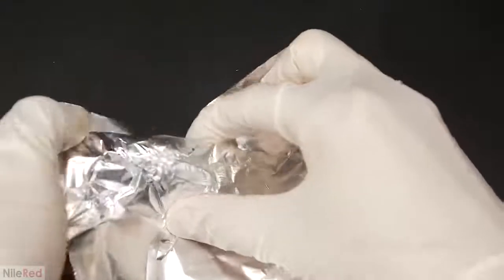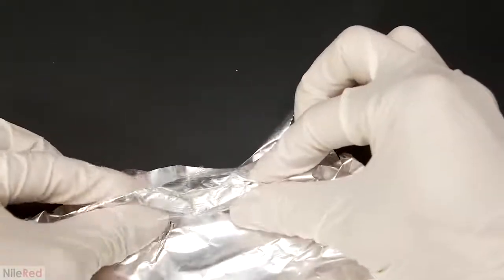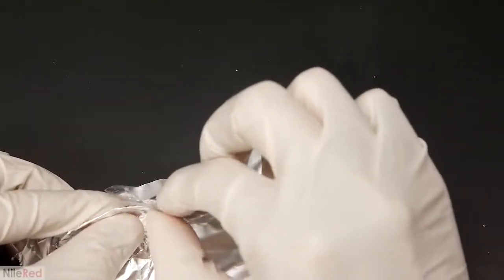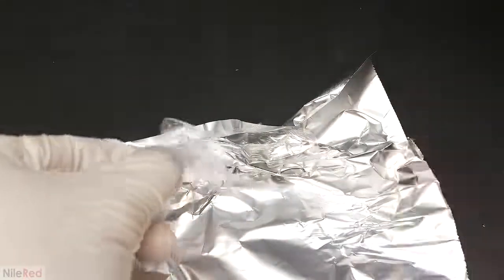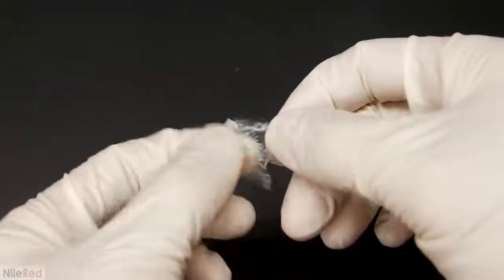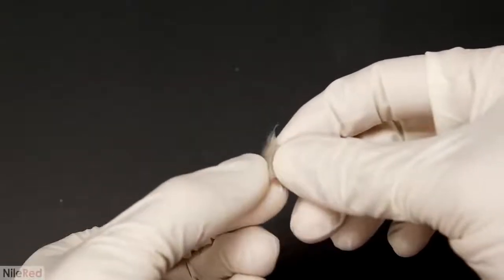Now over to the aluminum foil run, and it's a complete piece of garbage. Not only does it stick to the foil, but the film that it produces is uneven and pretty ugly. It might be able to fix this by first applying something like petroleum jelly, but I didn't try that out. I figured that even if it did work, it would be at best just as good as the glass dish, so it wasn't really worth it.